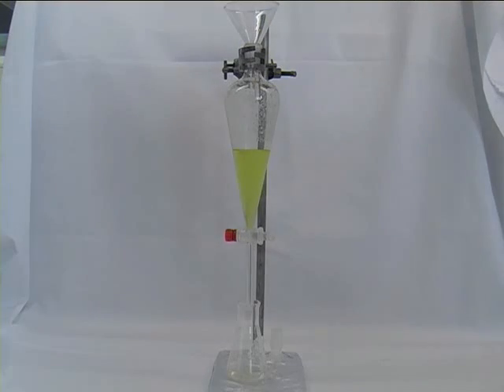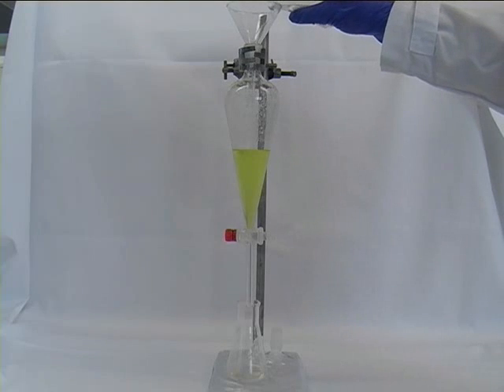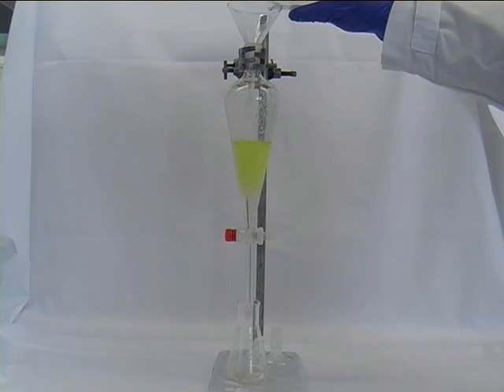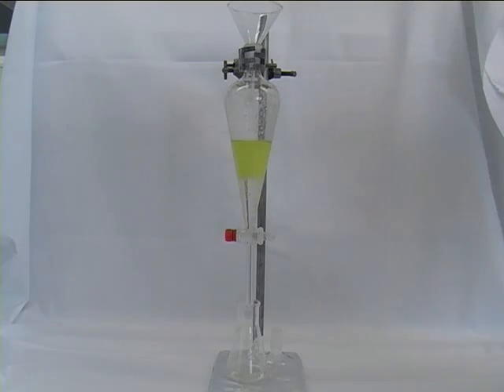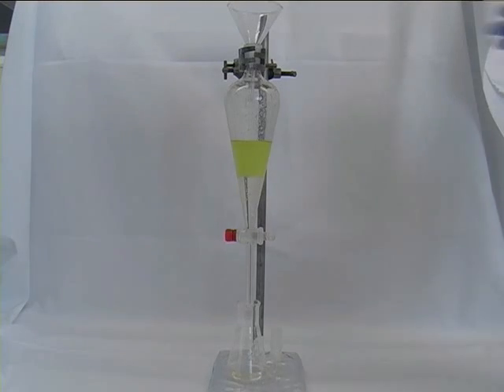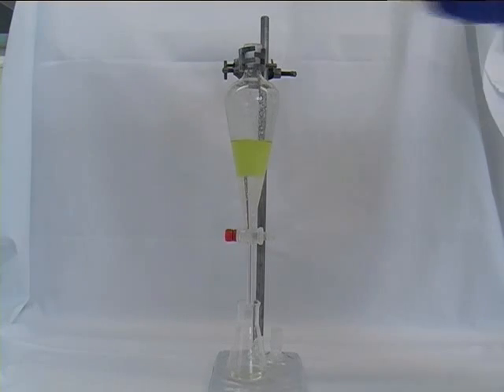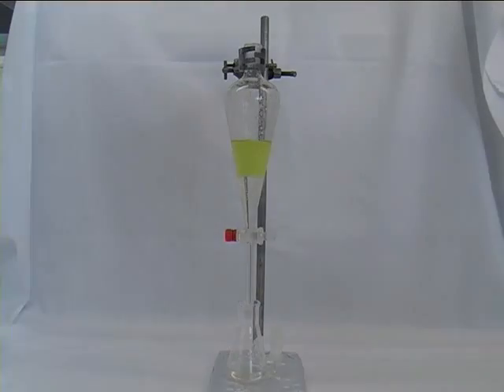In order to remove all impurities we might want to wash the organic phase a second time. So we add some more of our aqueous phase and repeat the whole process of stoppering the separatory funnel, venting it, shaking it.